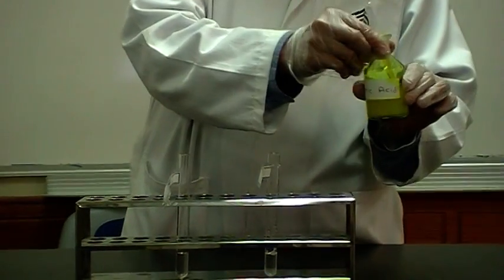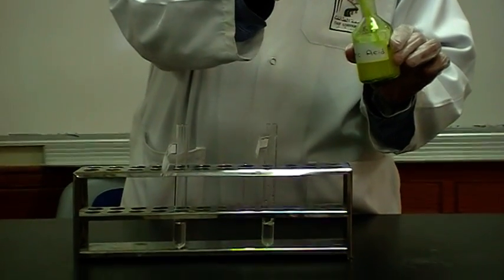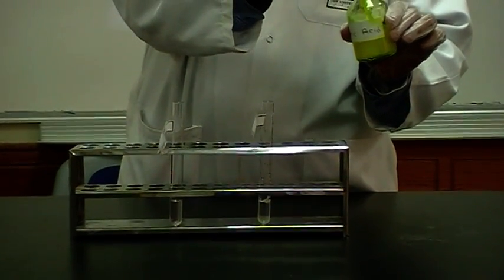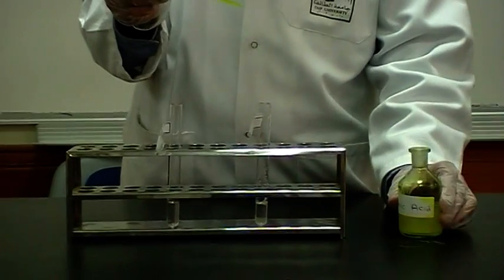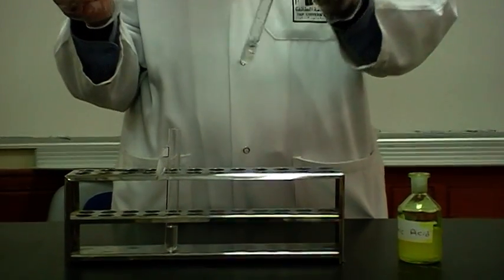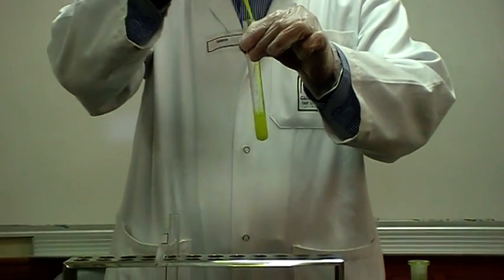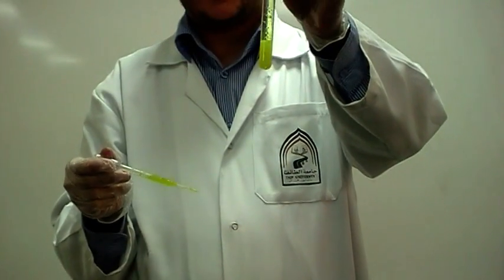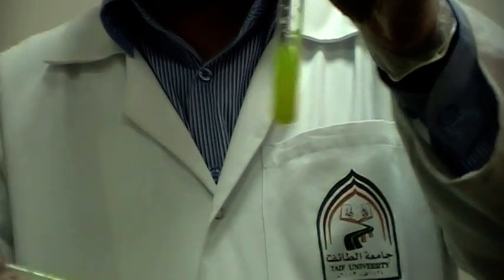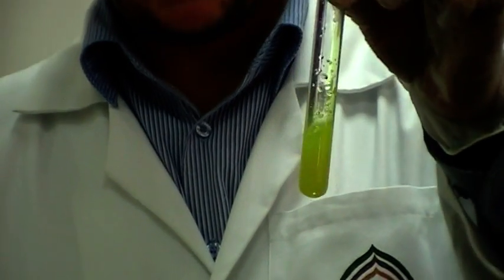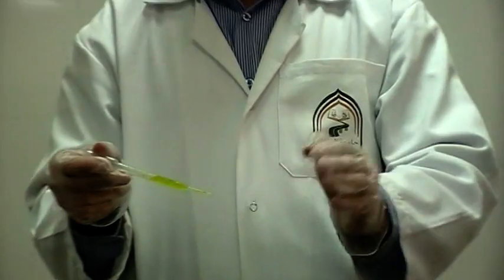Simply take Picric Acid solution. Take around a milliliter and add it here to gelatin. Can you see? Yellow gelatinous solution. This means we have yellow gelatinous precipitate for gelatin.